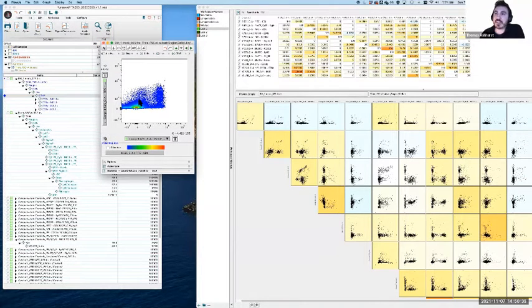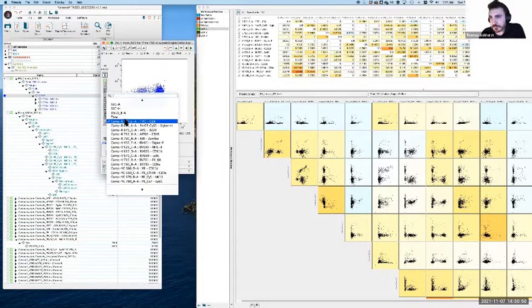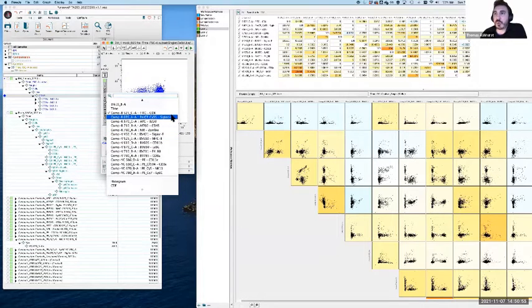That's not always the case. Sometimes, like in this case, FITC could have been the culprit, and for some reason it decided it needed compensation of 10 when actually it needed nothing. But typically, I think the problems come when you get heavy overlap. So if I look down this list, I have a couple of options. PerCP-Cy5.5 is going to pick up quite a bit of spillover from 2 fluorophores in particular, APC and PE-Cy5, as well as a couple on the violet. But I can make a reasonable assumption that it's PE-Cy5, I'm going to assume that that's my culprit. I'm just going to check that first.